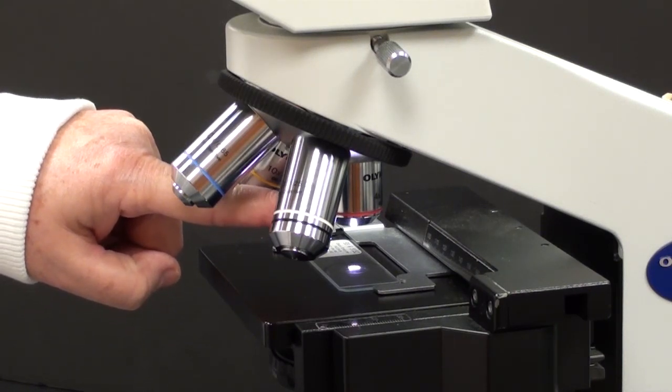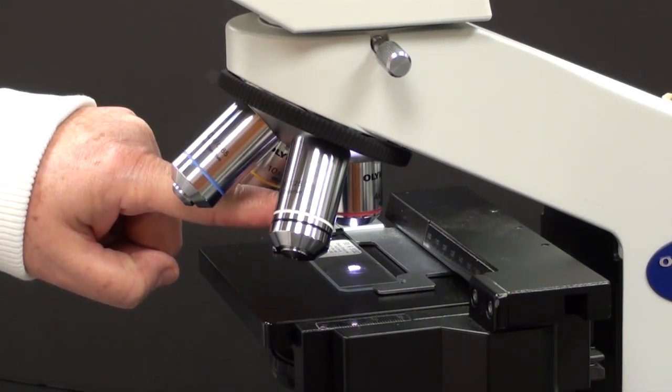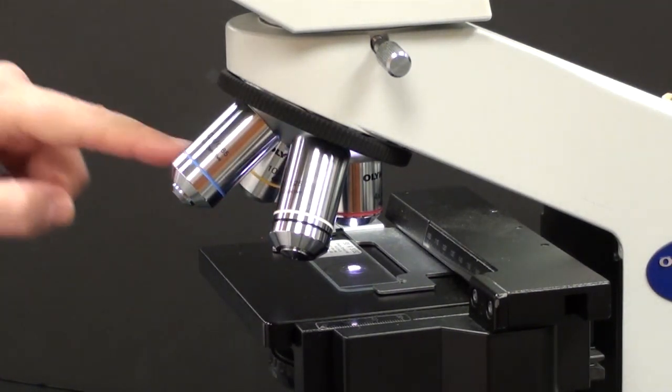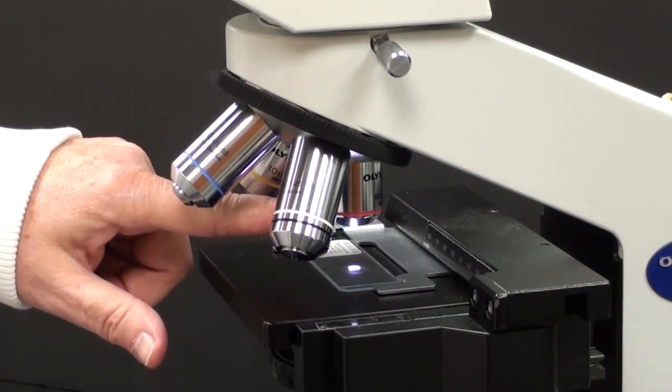When you're using it, it's a total magnification of 40x: 10 from the ocular eyepiece and 4 from the objective lens.